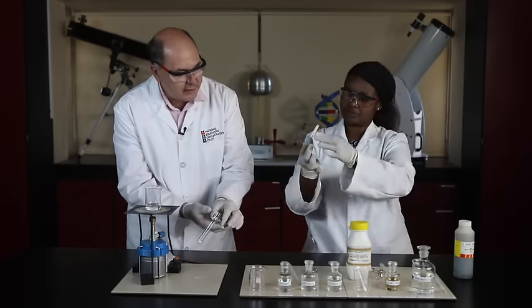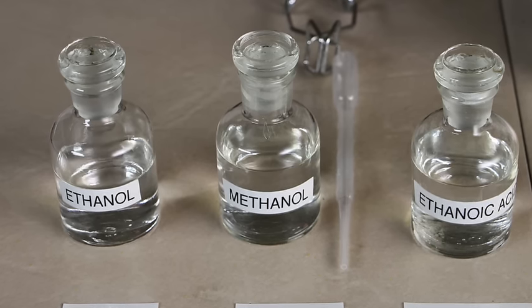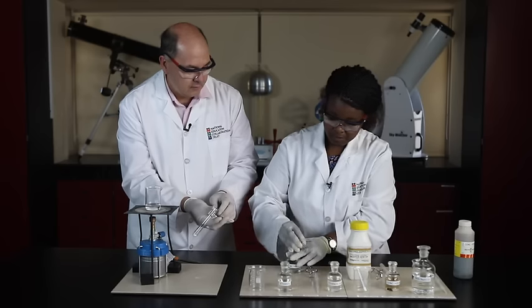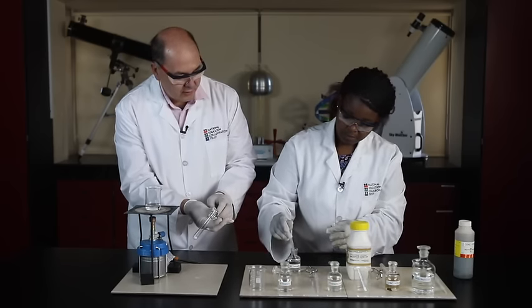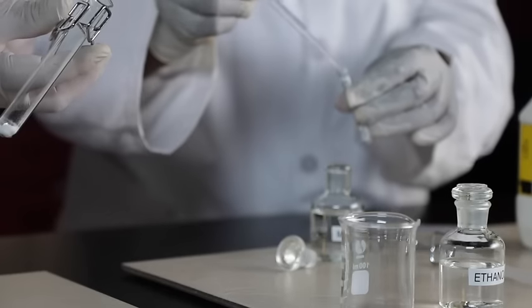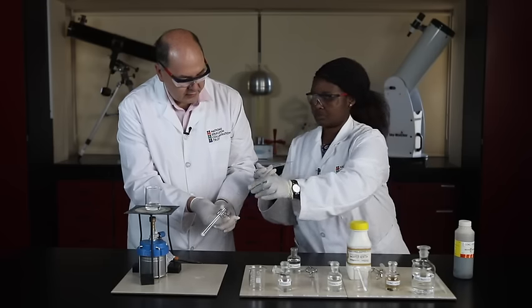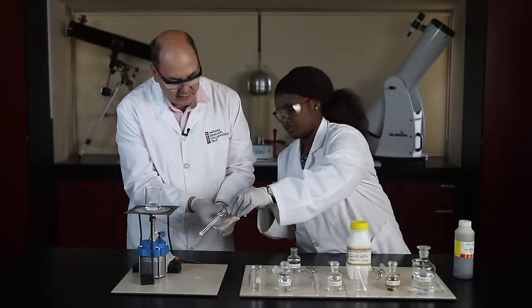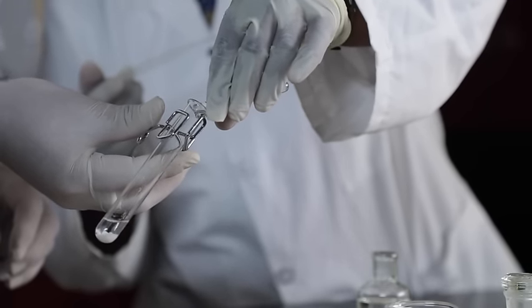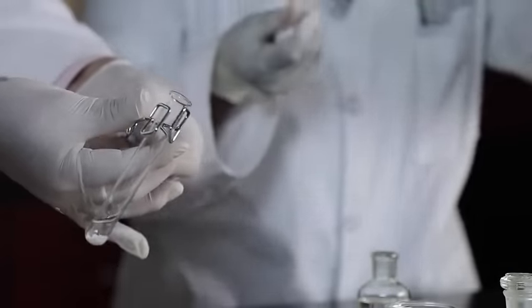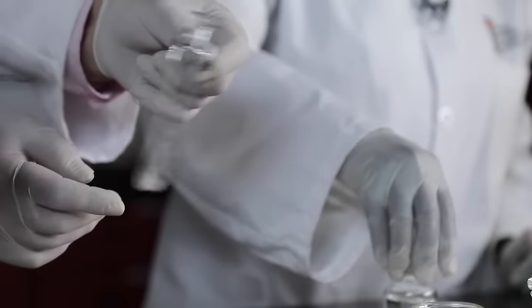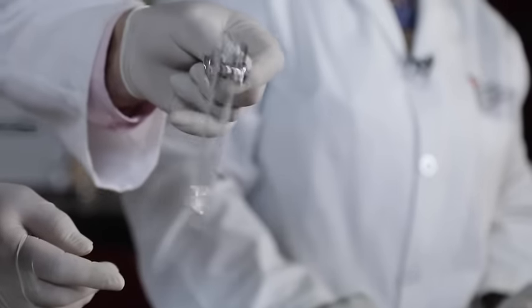Ok, I'll tell you what, let's take some of the methanol and let's rinse out the rest of the acid there. So take 3 mils of the methanol, add it to the boiling tube. There we go, shake it around. Now make sure that it flows down so we can get all of that stuff. That's it, beautiful, lovely. Ok, you'll see that the acid hasn't totally dissolved, but I'm swirling it. More or less dissolved. Alright, what should we do next, Joyce?